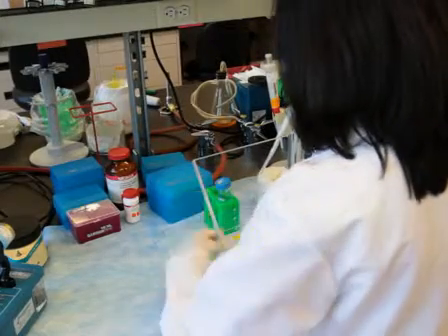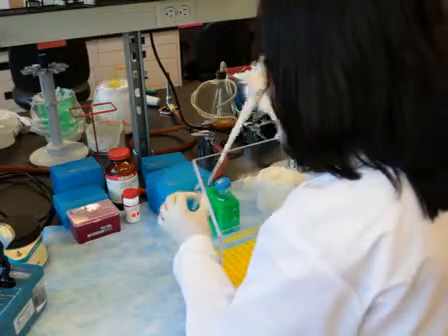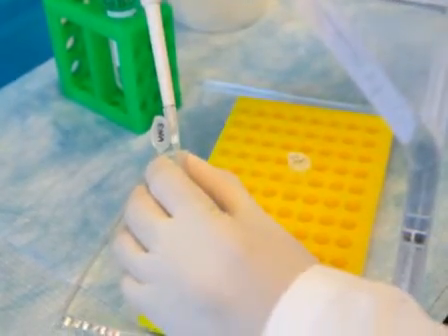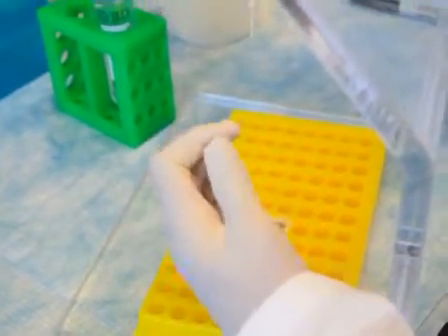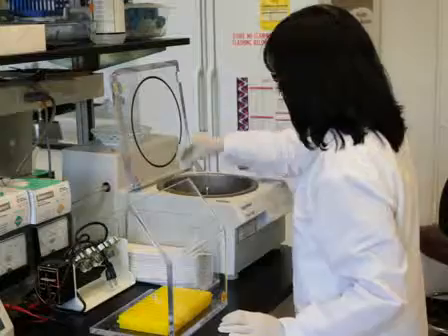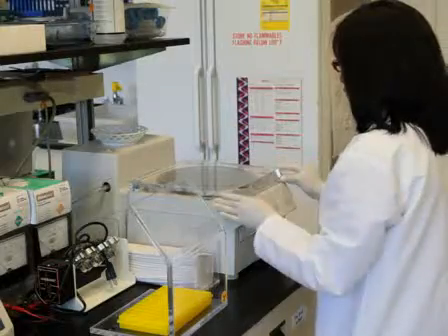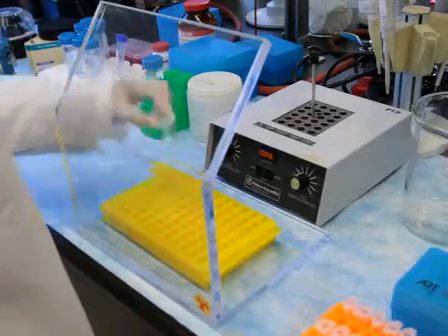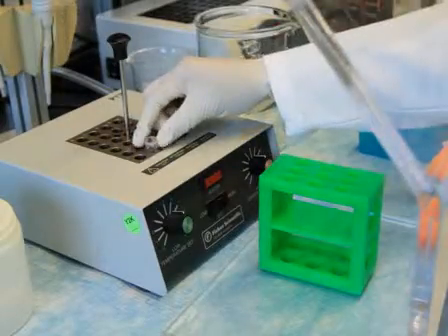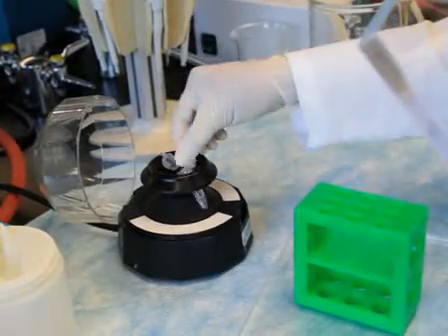Next, dissolve the purified P32 labeled RNA samples in 330 microliters of 1x reaction buffer. Pipette 30 microliters of the RNA solution into a new reaction tube. Precipitate the RNA with ethanol and then dry the pellet in a vacuum. Once dried, this pellet can be used for generating the reference ladder as described in the written procedure. Denature the remaining buffered RNA solution by heating at 95 degrees Celsius for 2 minutes. Cool the samples to room temperature for 15 minutes and follow with a quick spin to bring the condensates back into solution.